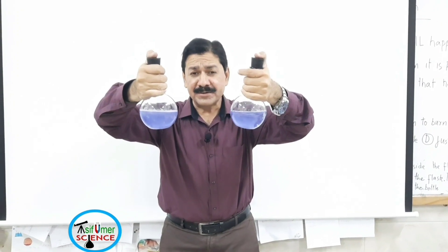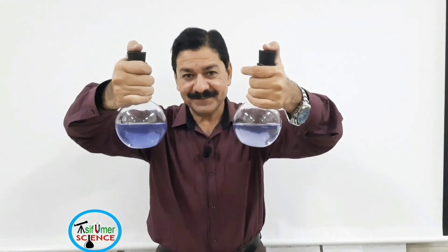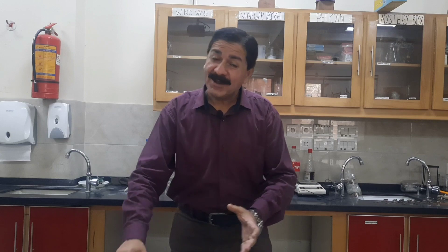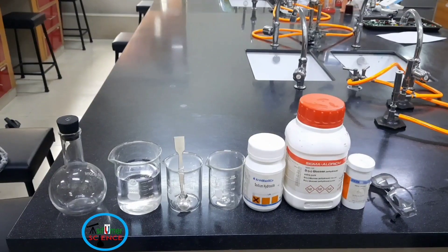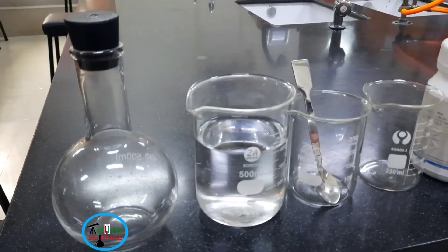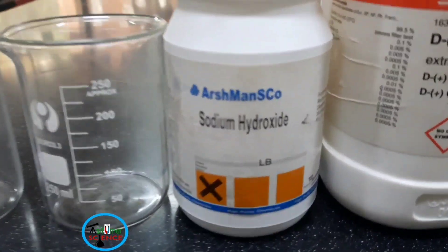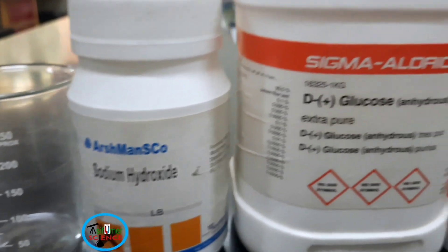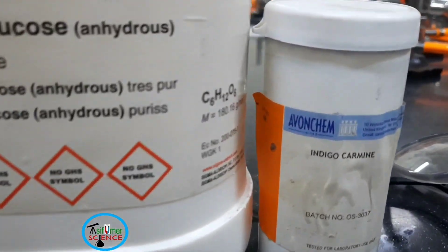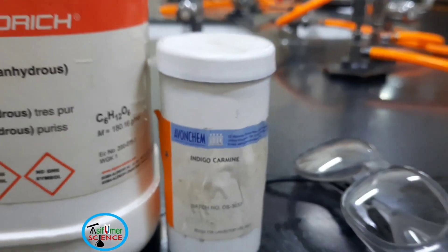This demonstrates oxidation and reduction reactions and the rate of chemical reaction. Our second activity is the Traffic Light Bottle, which mimics traffic light signals. For this activity, the required things are a flat bottom flask, beakers with water, spatula, sodium hydroxide, glucose, indigo carmine indicator, and safety goggles.